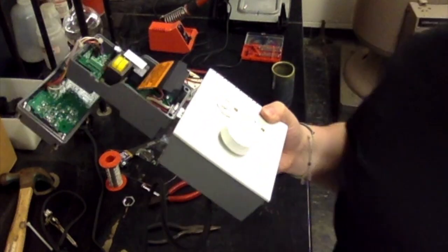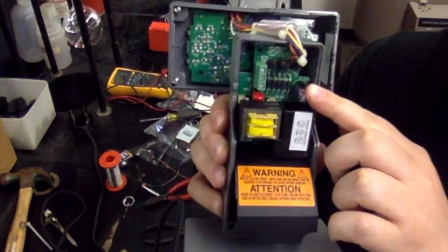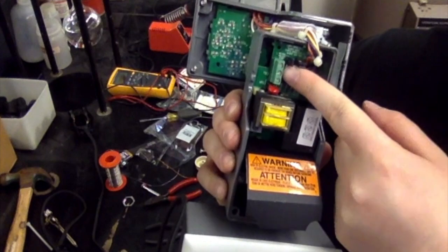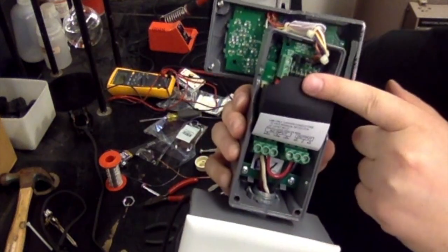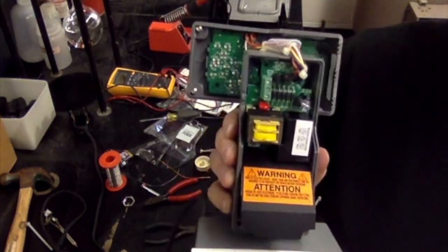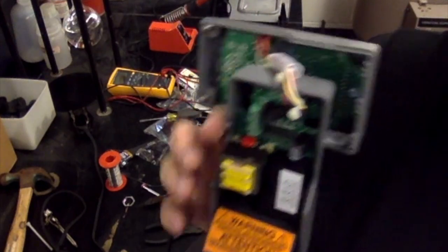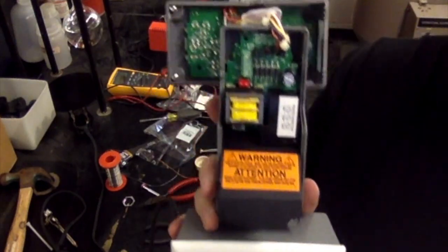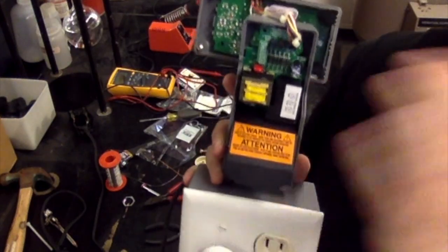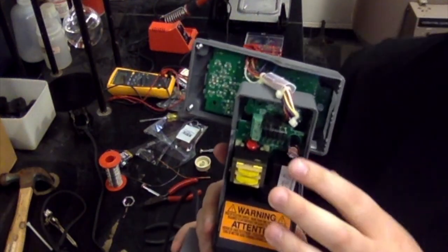We just have a couple more connections we need to make, and they're all focused up here at the top of A419. So you'll notice over here we have something that looks familiar, something we work with down here with these ports. I've numbered these 7, 8, and 9. Again, the same as in the file, so if there's confusion, look there. And this is where we're going to be connecting the thermocouple. But before we do that, we need to reconfigure this, because when you buy it, it comes as a cooling configuration at top, and we want the heating configuration.